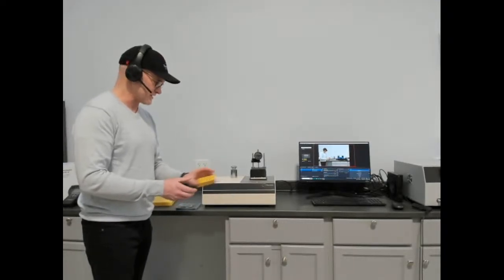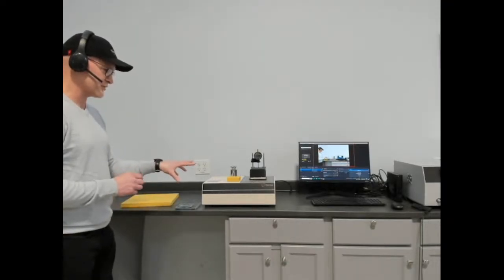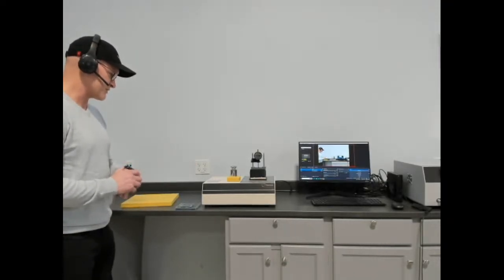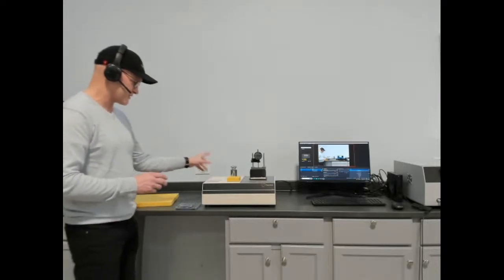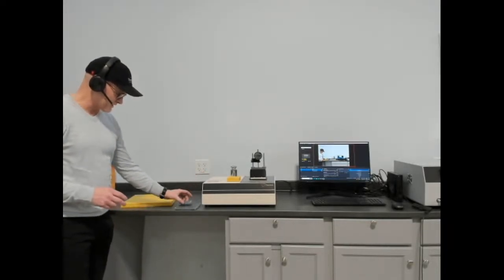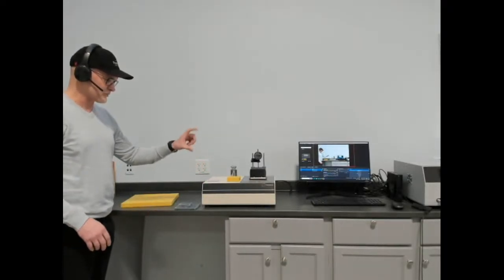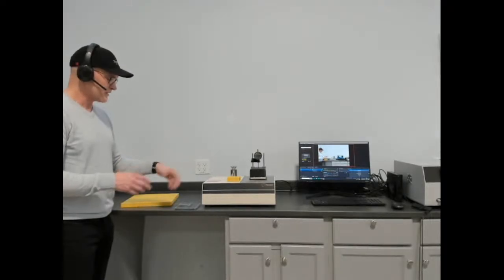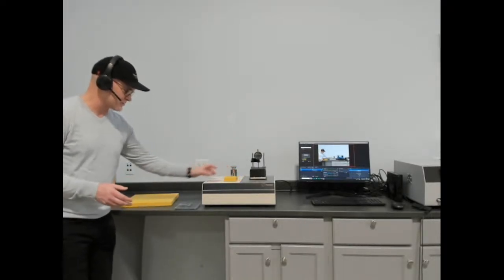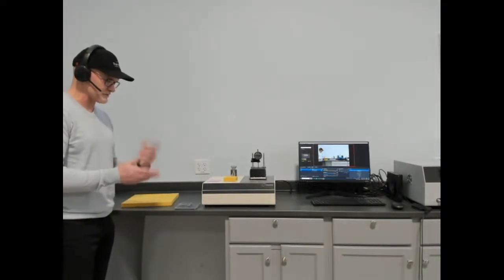as you see with the included NIST. So the basic steps for making a measurement would be to calibrate the instrument to your room temperature environment with a delta T appropriate to your sample. In this case, we've already calibrated the instrument over a number of ranges, and actually if you calibrate the instrument with a number of delta T's, you always have them. And then you can verify those calibrations routinely with these two materials that come with the instrument.